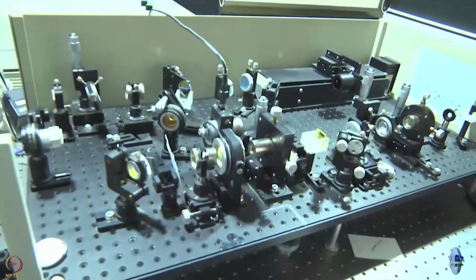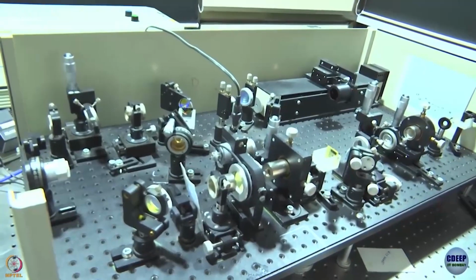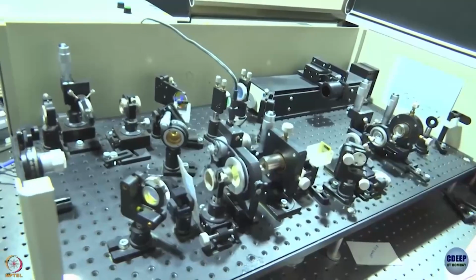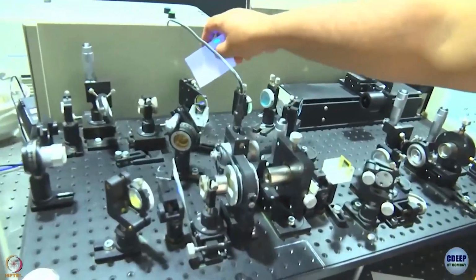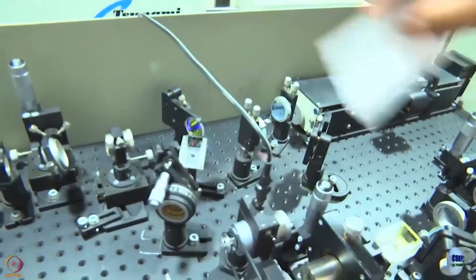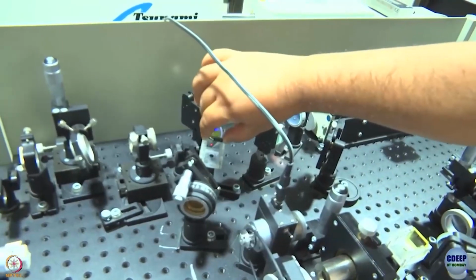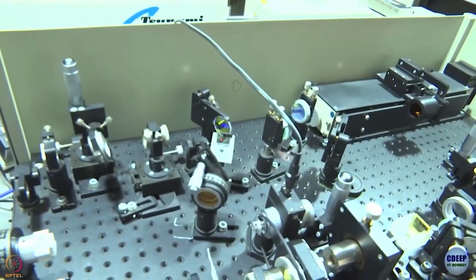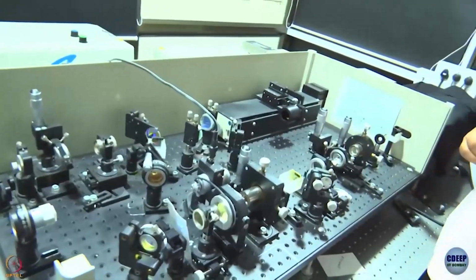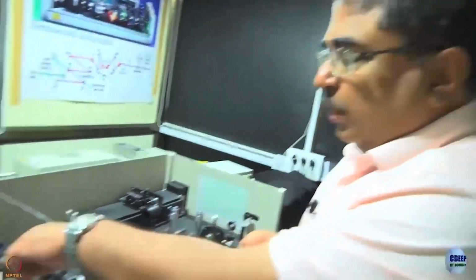Now, let us talk about fluorescent light. I will show you the path first while the light is on, then we will switch the light off and show you the fluorescence. So, now remember, this is the beam splitter. Red light has gone through and blue light has been reflected. In the path of blue light, we use these pieces of optics which are called neutral density filters. The reason why we use them is that you do not want to put too much light on your sample, or it will get destroyed. So, from there blue light comes in.